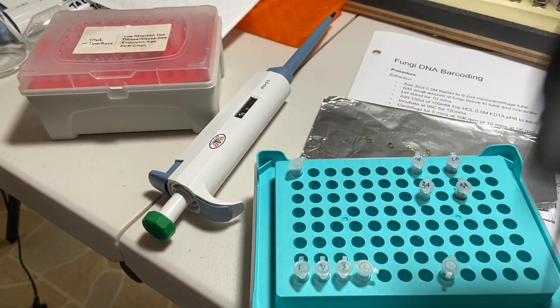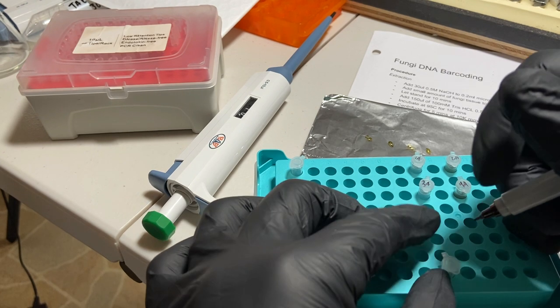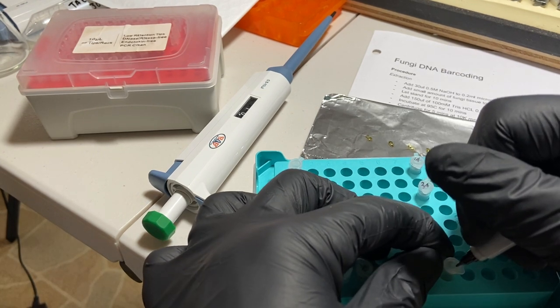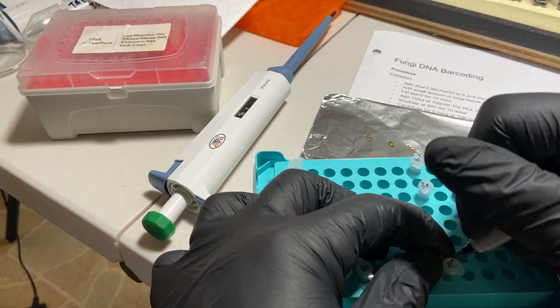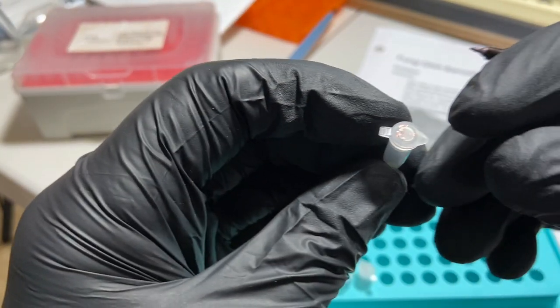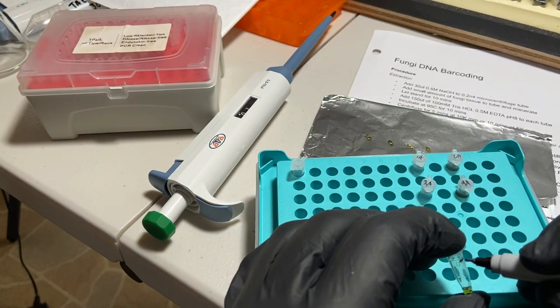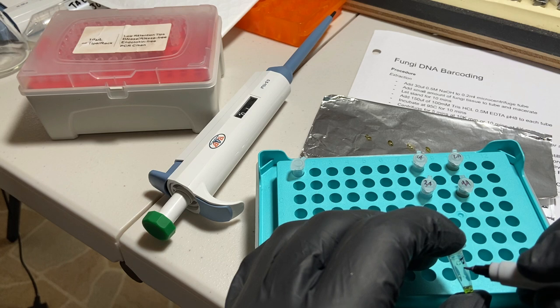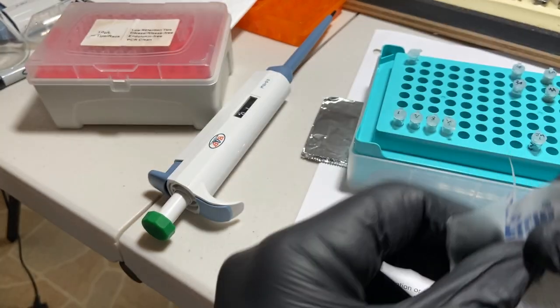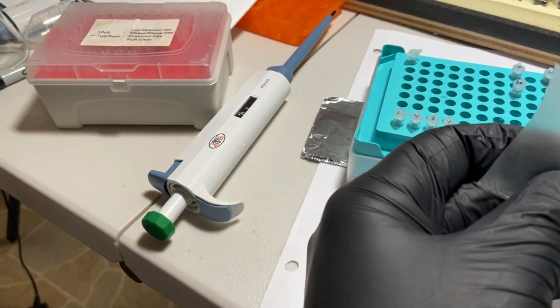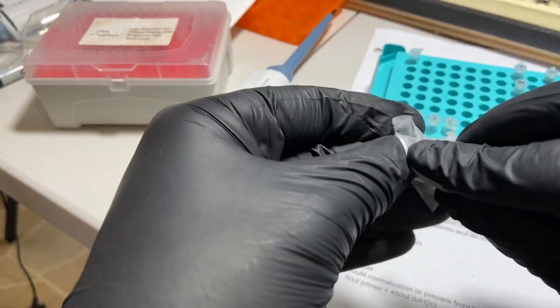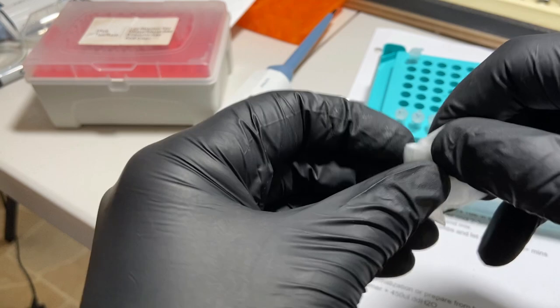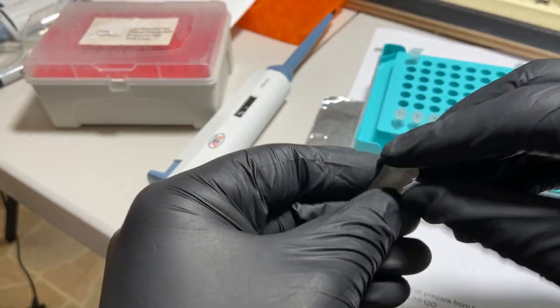And now that we've placed our sequencing order and we've already run the PCR reaction for the DNA barcoding process, we're now going to be preparing to send our PCR product to the lab for sequencing. And we'll do that by taking an empty tube, as you see here, and labeling it JM1 per the submission guidelines. Note that I didn't capture it, but 10 microliters of the PCR product has already been added to the tube. Once the tube is labeled, I'm now going to wrap the tube in some parafilm. And this is to help prevent the lid from popping open during transport. You could use tape if you don't have any parafilm.